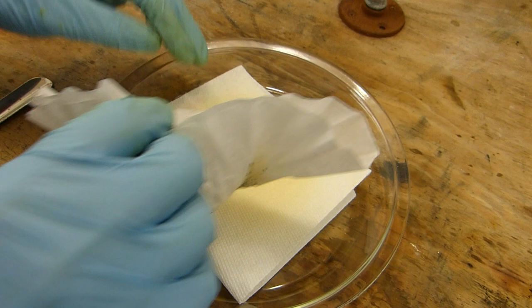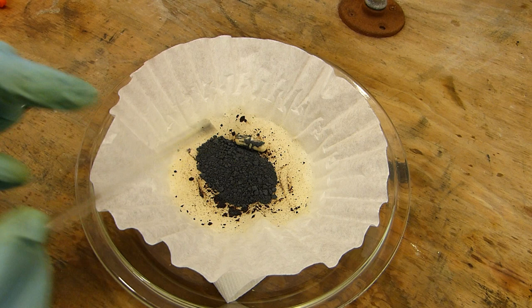You can see I changed the bottom pad as well. I think this is ready for flipping over. Anyway, I'll give this another couple of minutes.